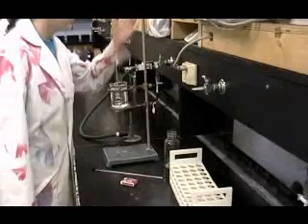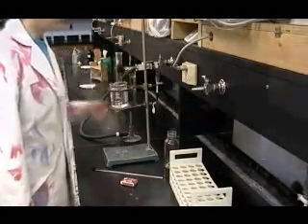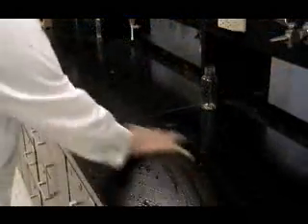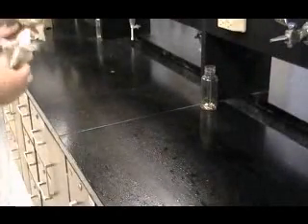The presence of methyl salicylate can be detected by its minty aroma. Once finished with the experiment, return all materials and remember to clean your lab area.